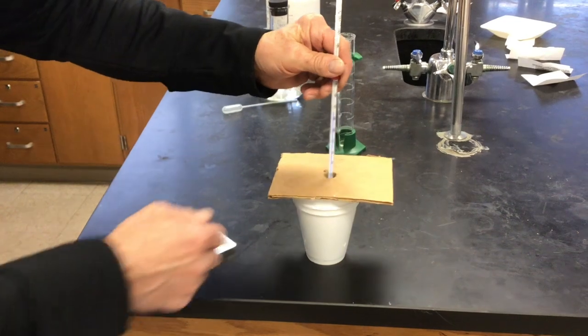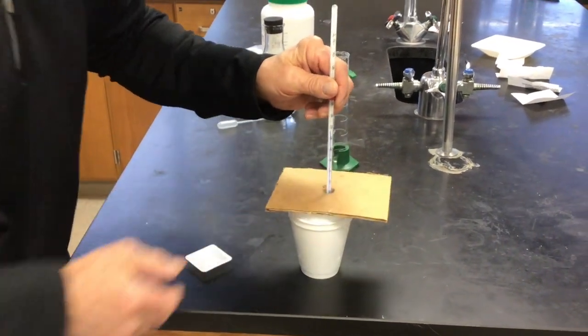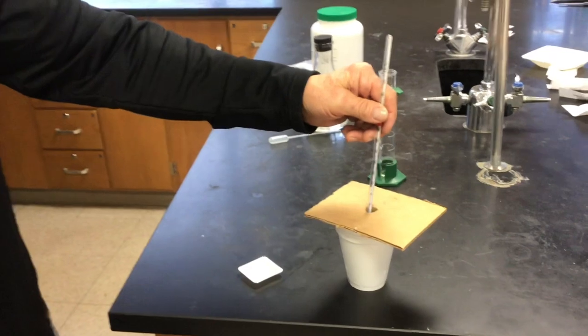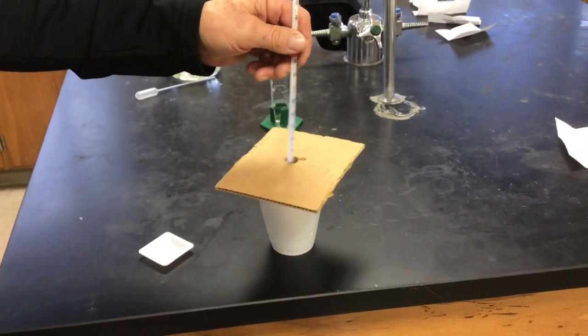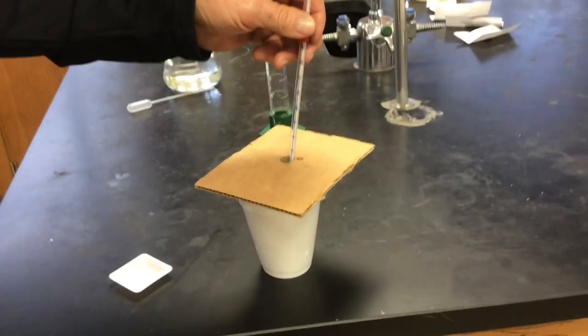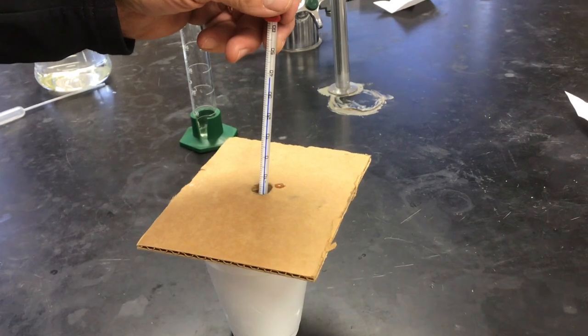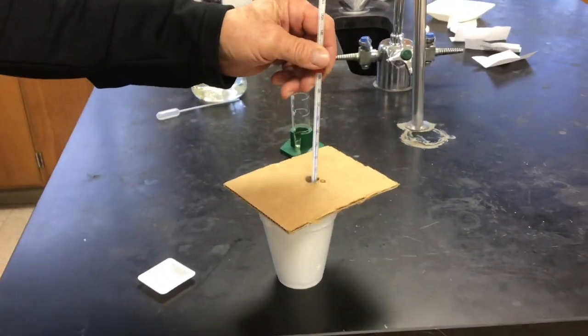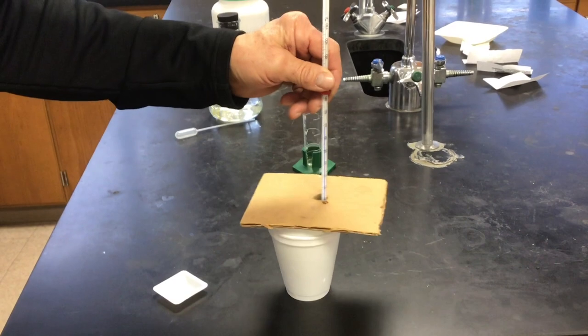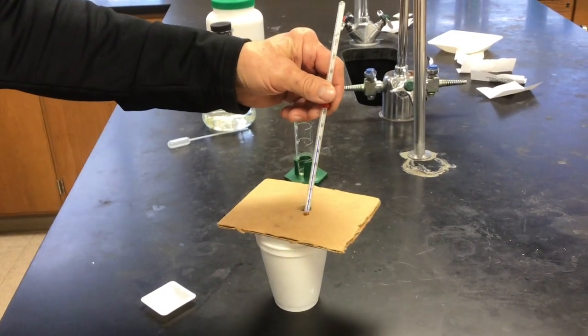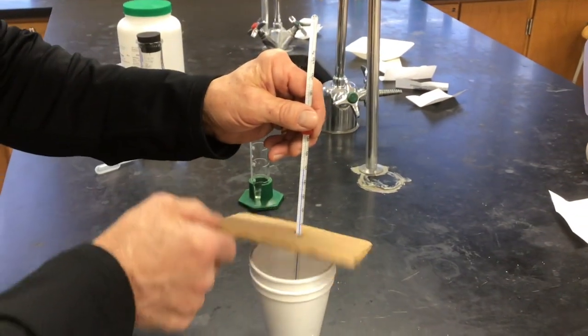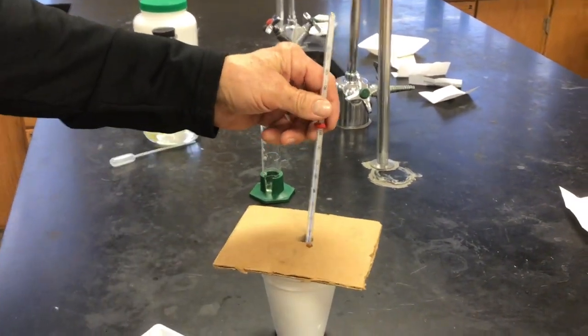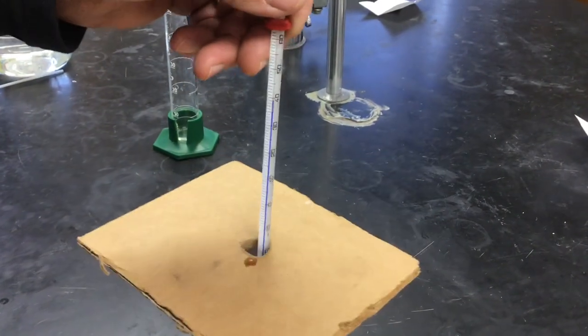We won't do that in the next trials, will we? No. I don't know if you can see the thermometer from the camera. We have quite a temperature change. All we can do is sit back and wait until the temperature stops changing. I think all the magnesium is gone.